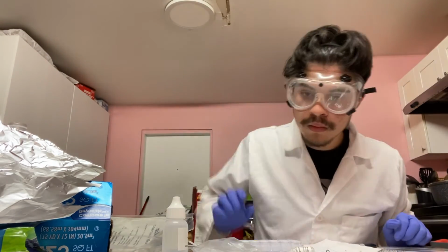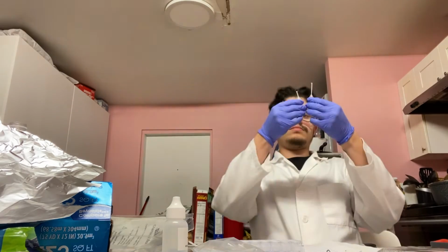Now, let's transition into part 2. To start, place a white sheet of paper on the table. Grab the 24 well plate and set it on top of the paper. Compounds in the form of pipettes are going to be used to create chemical reactions. With scissors, carefully snip off the tips of the pipettes.